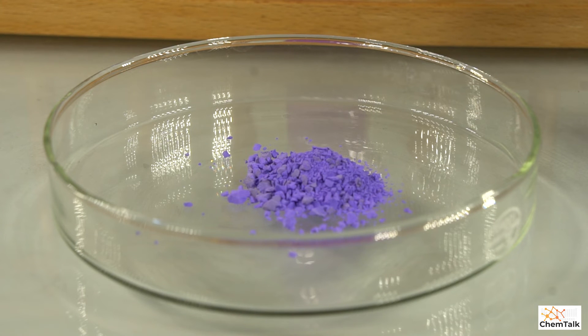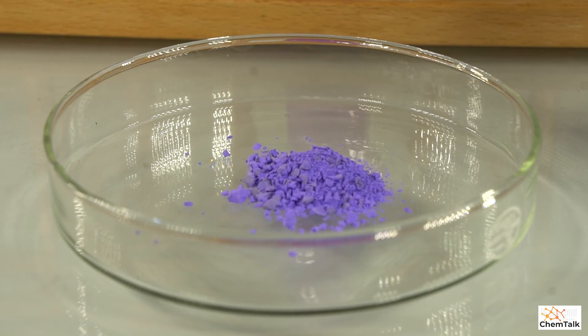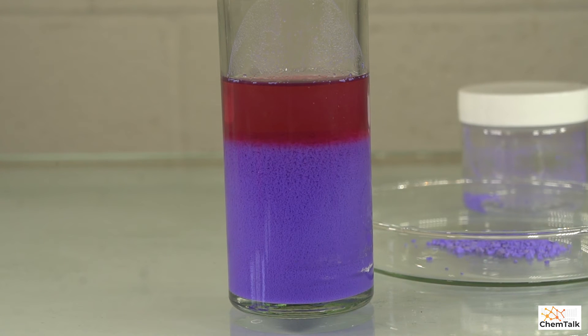Okay, so the precipitate settled out really, really nicely. Look at that. Look how beautiful that is. I actually had to transfer this into a separate container and swish it around for a minute to break the suspension.